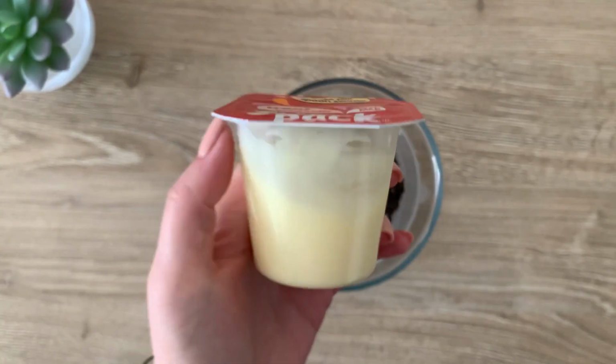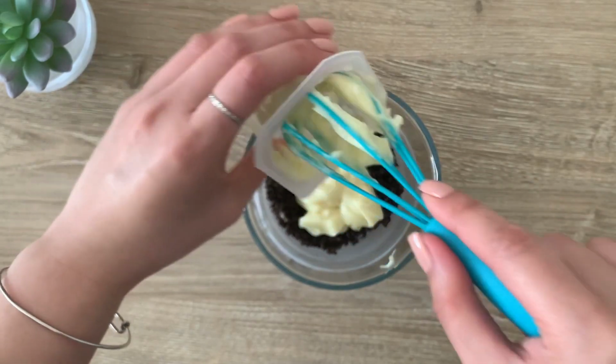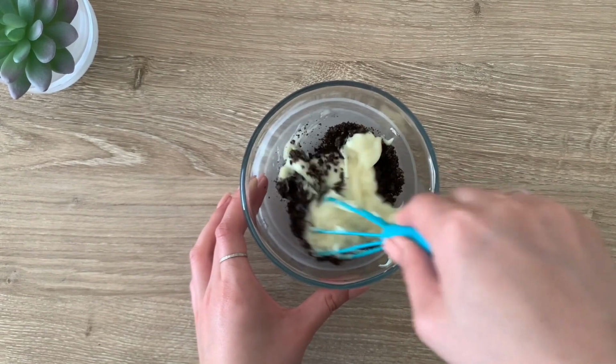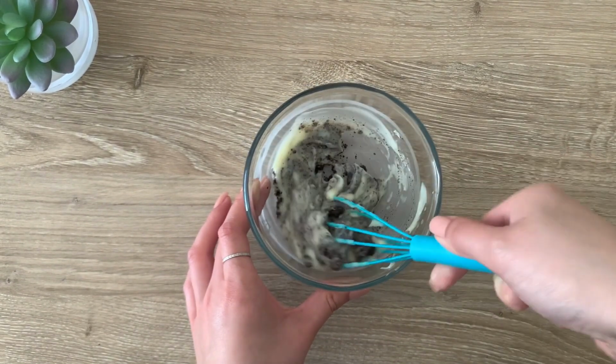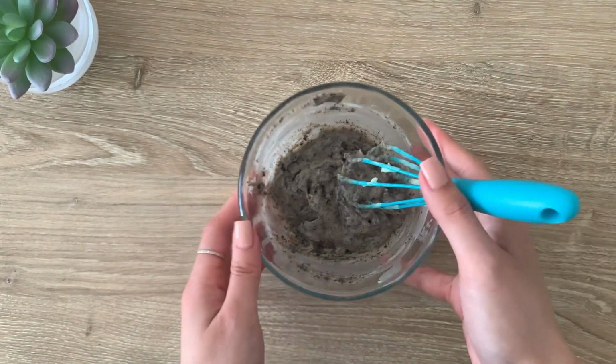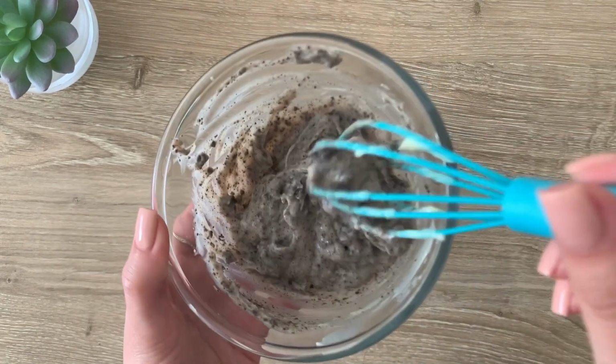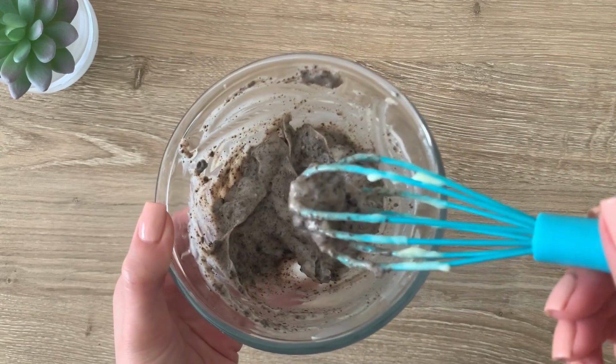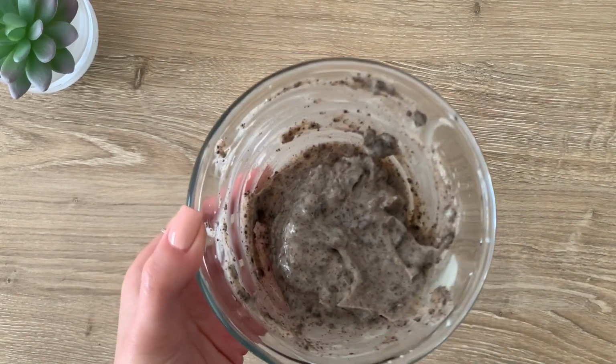Next, we're going to add our inactive ingredient, the vanilla pudding. Now we're going to thoroughly mix until it becomes one single product. So as everything's evenly mixed, in the pharmacy world, this would be considered a very thick suspension, and it would be ready to be bottled up and sent to the pharmacist for verification. But for now, you have yummy cookies and cream pudding.